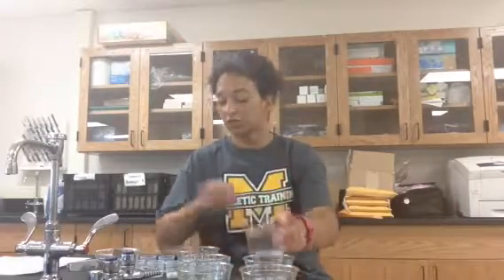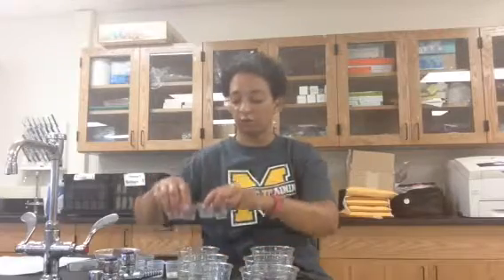You also have some little medicine cups back here. You have 12 total. You're going to measure out 5 milliliters of each of these solutions into its own little cup. So I have 6 cups: negative control, positive control, and then patients 1 through 4 right here. I also have 6 cups of 5 milliliters of milk.